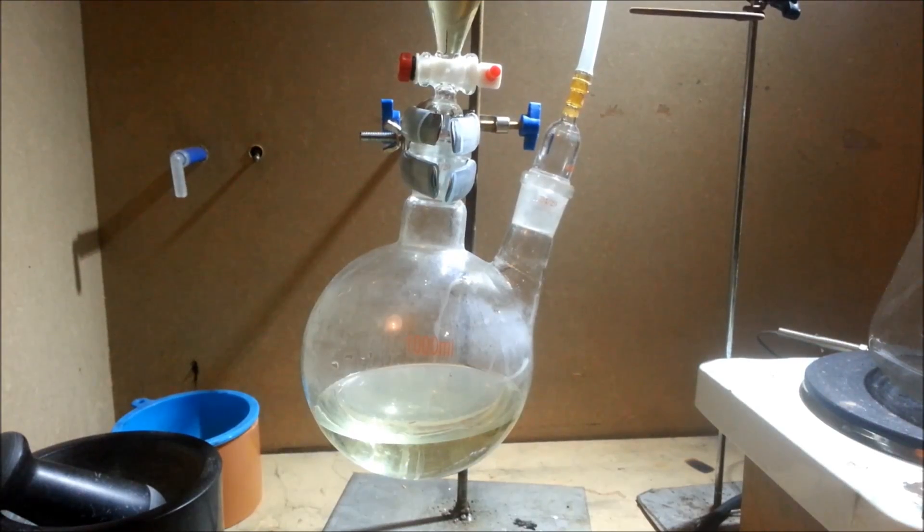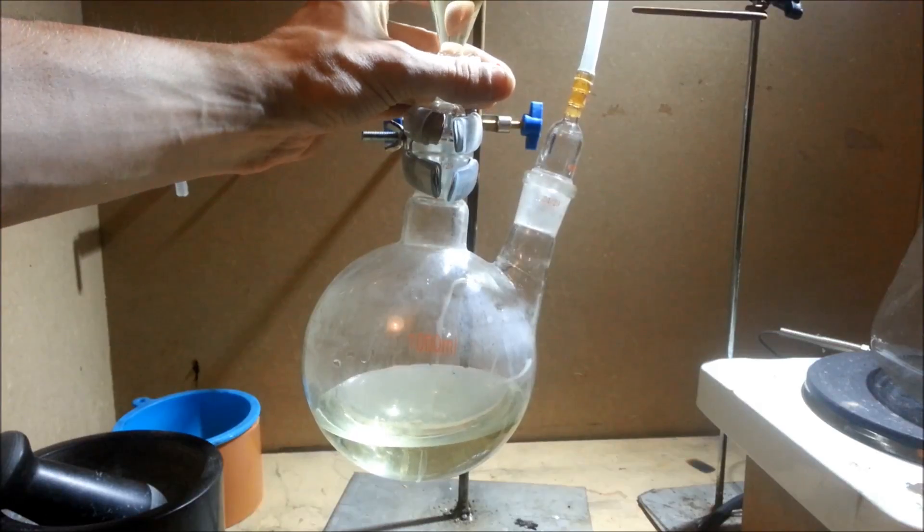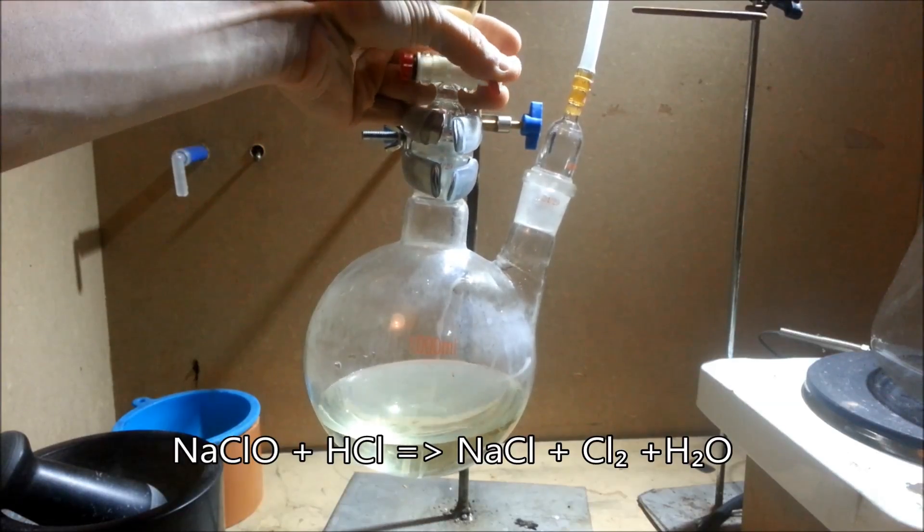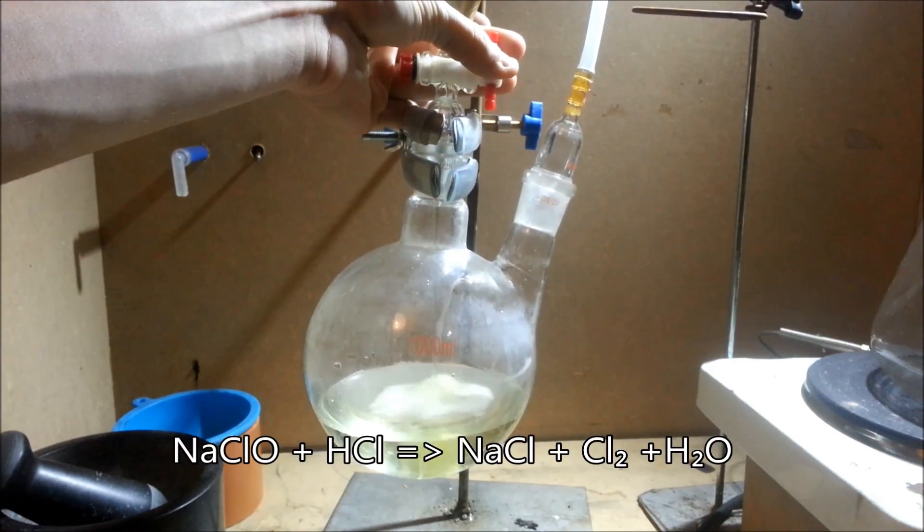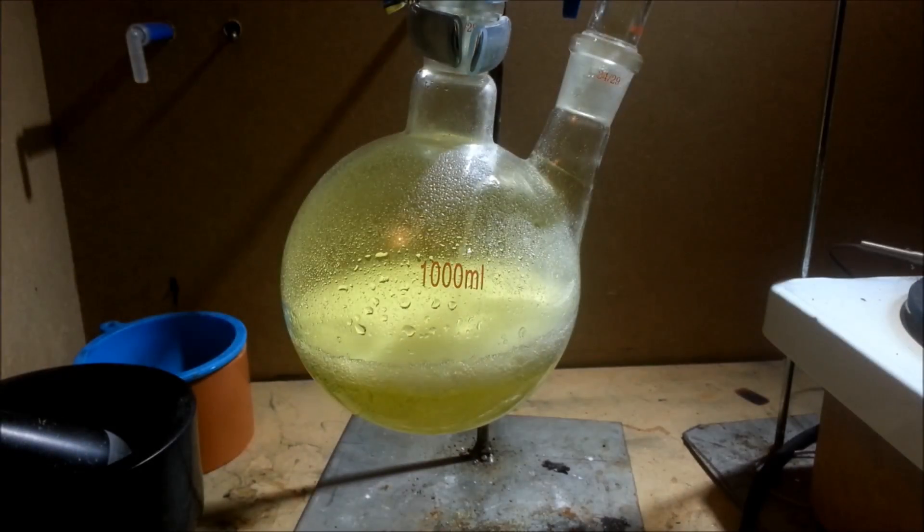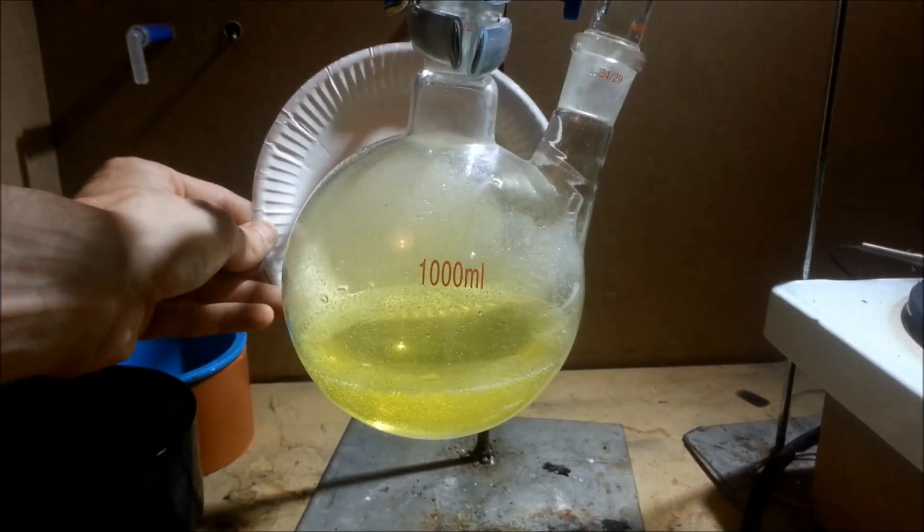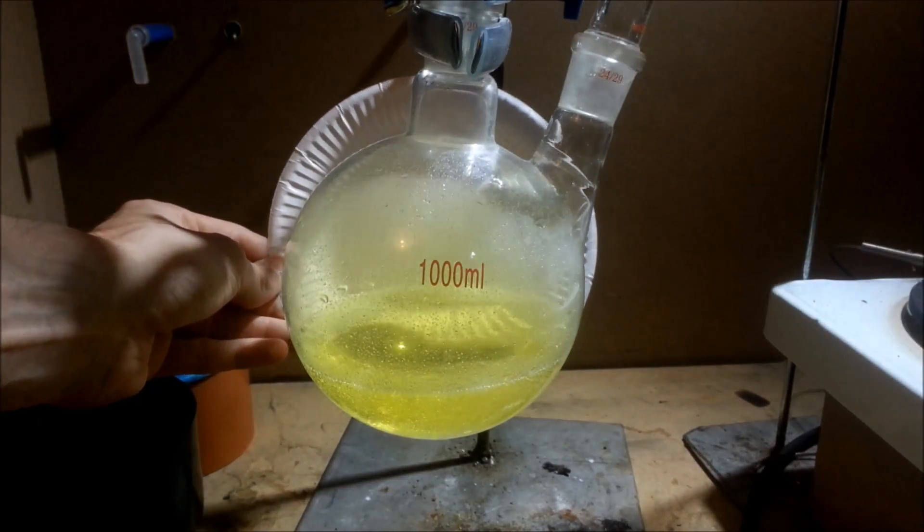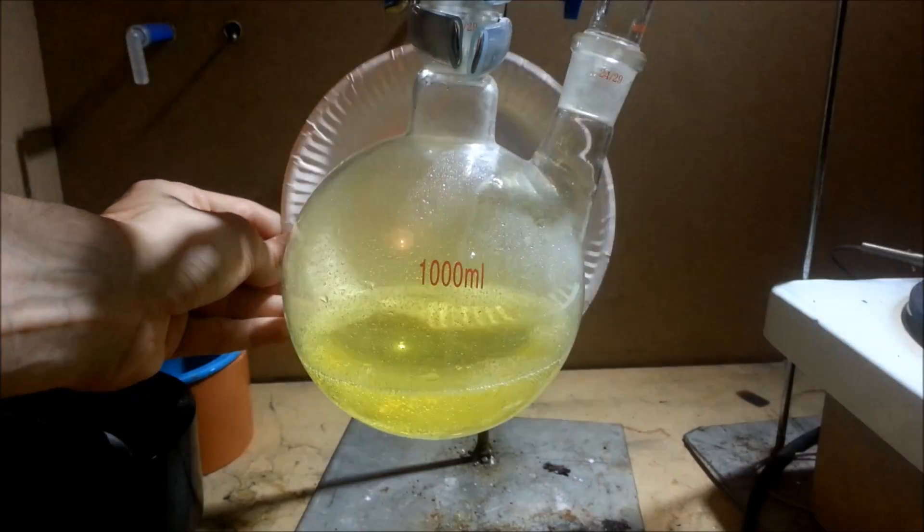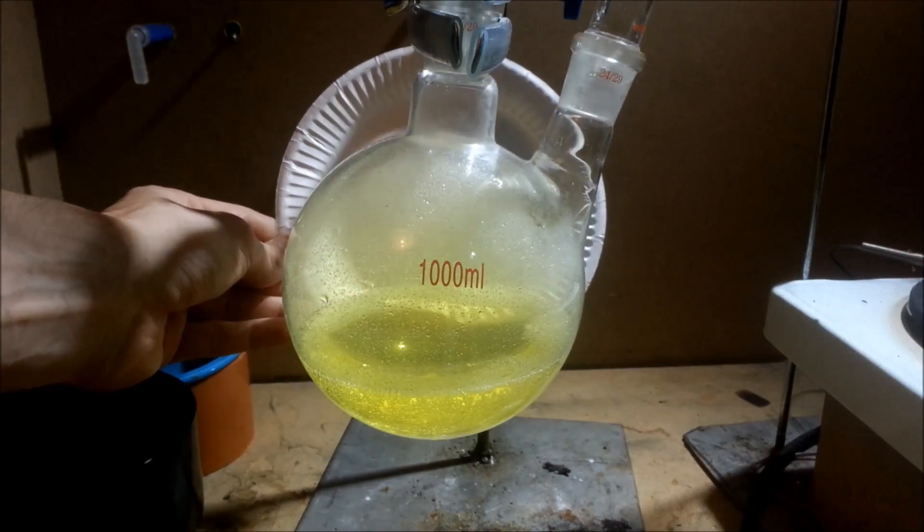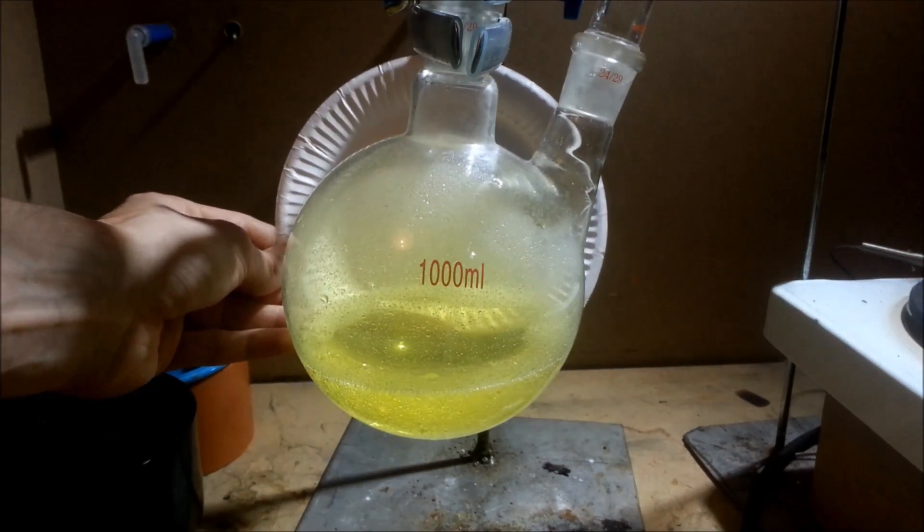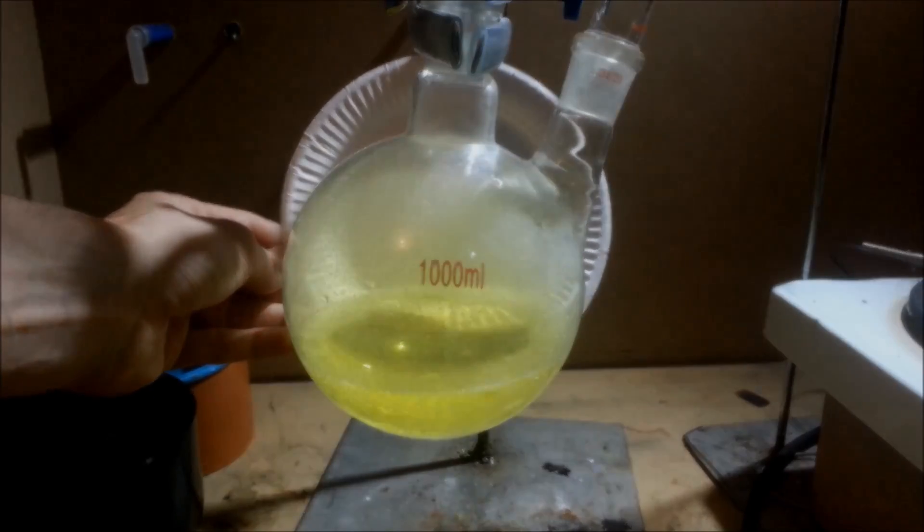The valve was then opened and the hydrochloric acid was allowed to react with the hypochlorite solution, forming sodium chloride, water and chlorine. After a while the bottle should show a green-yellow discoloration, which then travels up the tube and down the Erlenmeyer flask. Depending on the actual quality of your hydrochloric acid or hypochlorite, additional volumes may be necessary in order for the reaction to run to completion.